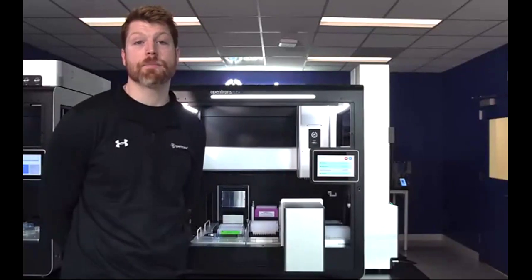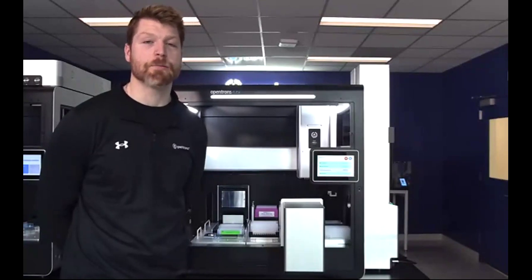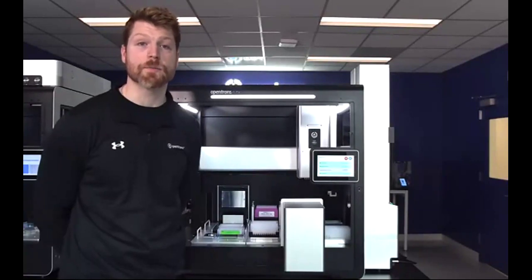Once the tips in a particular box are used, the gripper can pick up the empty tip rack, or the pipette tips can be returned to that tip rack, and then the gripper can throw all of it away into the trash chute. The stacker can then move a new tip rack onto the side of the deck in a gripper accessible position, and the gripper picks it up and moves it to where the pipette can actually access it in that now freed up position.